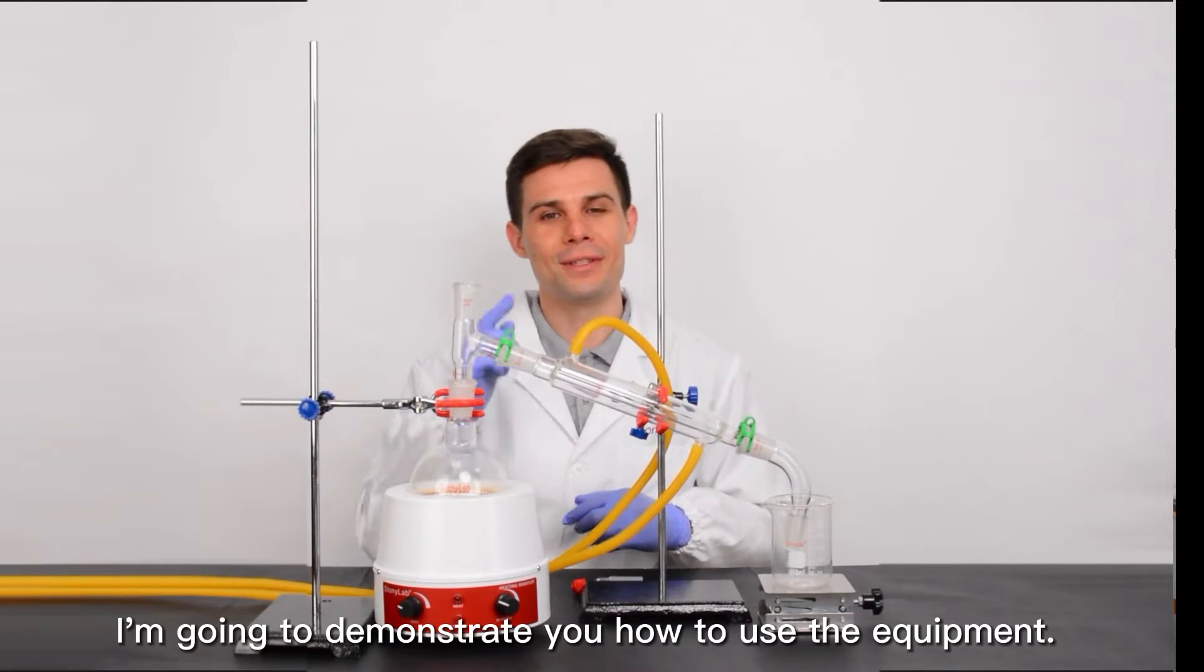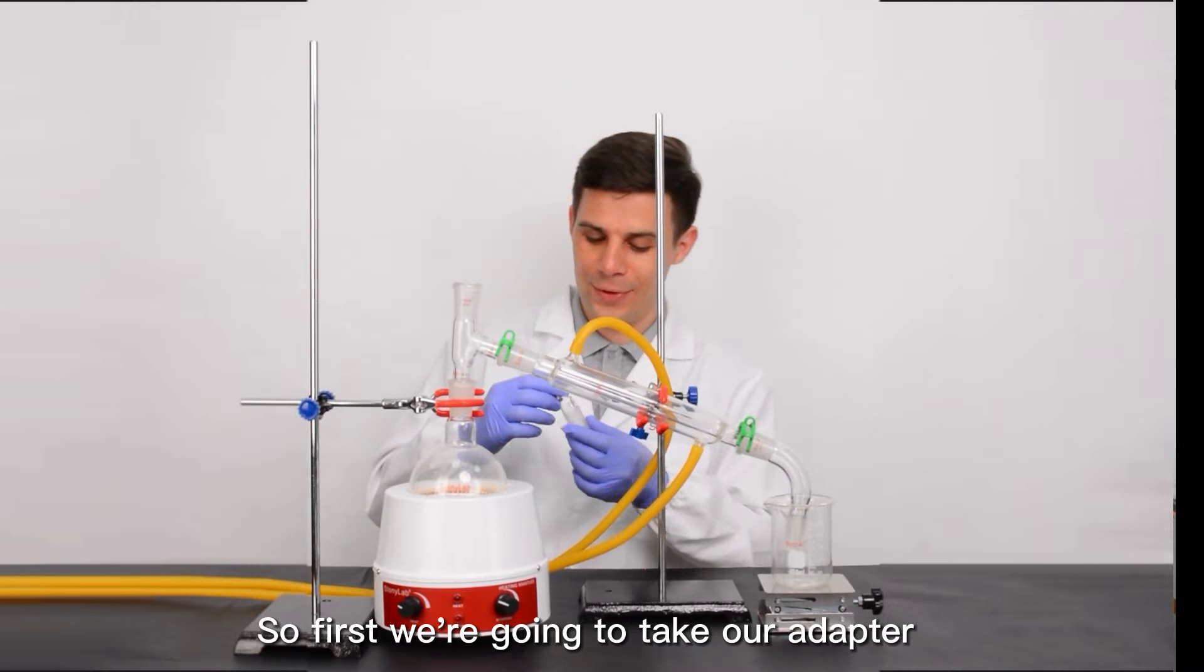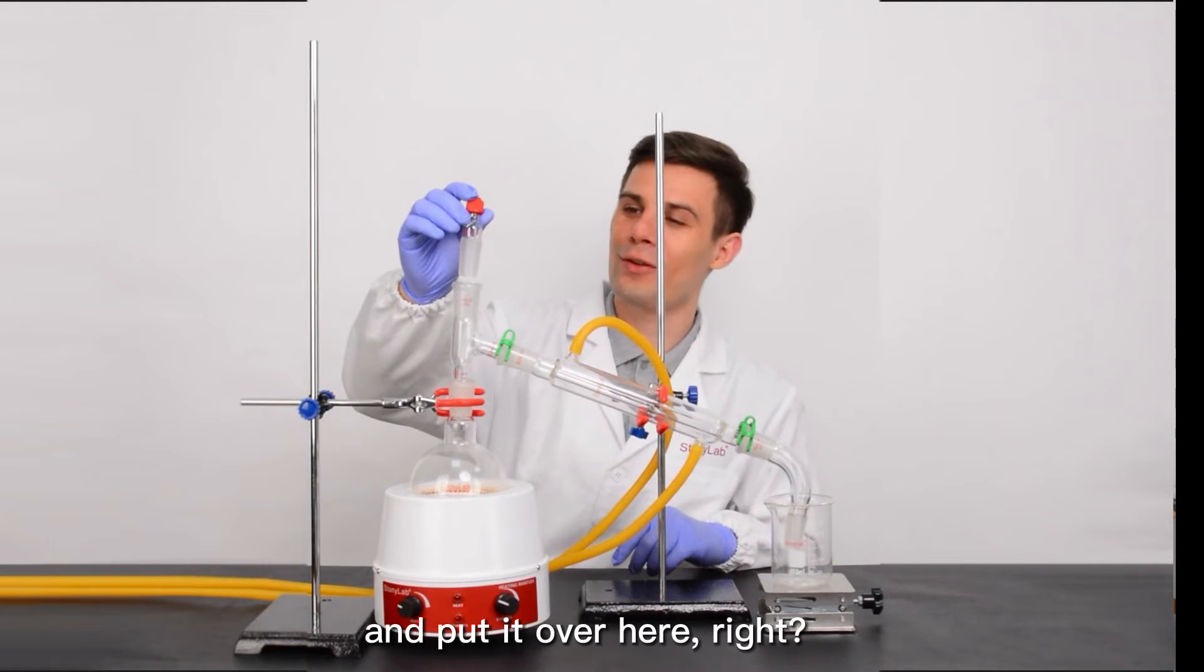Now, I'm going to demonstrate to you how to use the equipment. So first, we're going to take our adapter and put it over here.